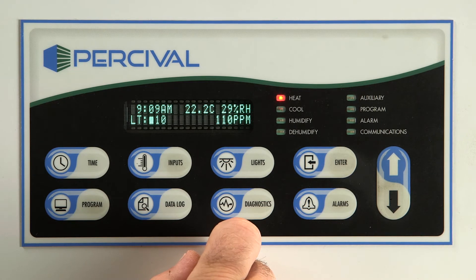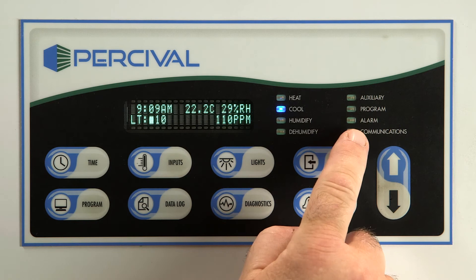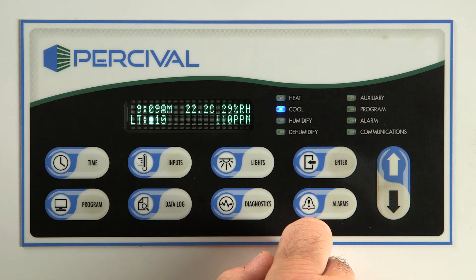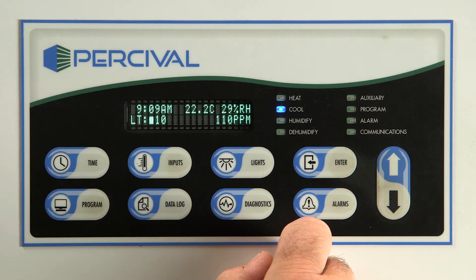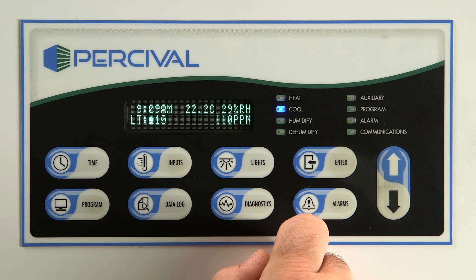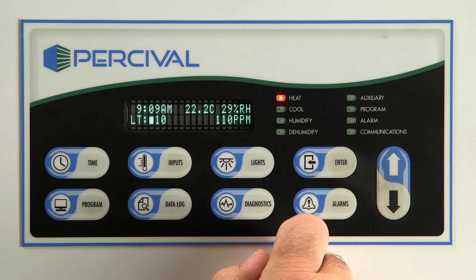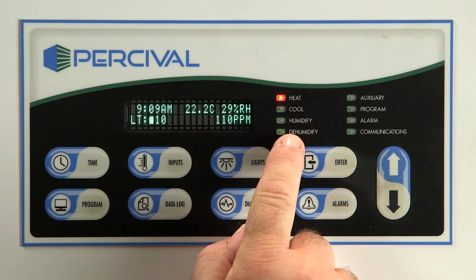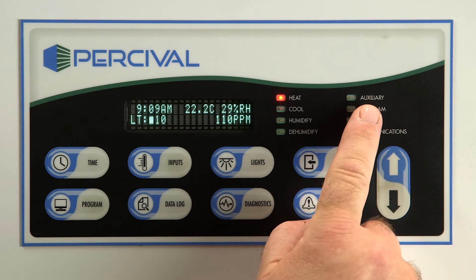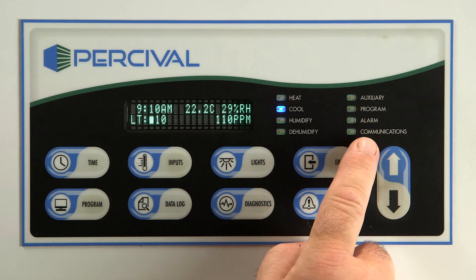To the right of the display are 8 LED indicator lights. Keep in mind that your chamber may not be equipped with all features. Most chambers will always be in either heat or cool — these cycle to maintain a constant chamber temperature. Next are humidify and dehumidify indicators. To the right are indicators for the auxiliary channel, program, alarm, and finally communications.